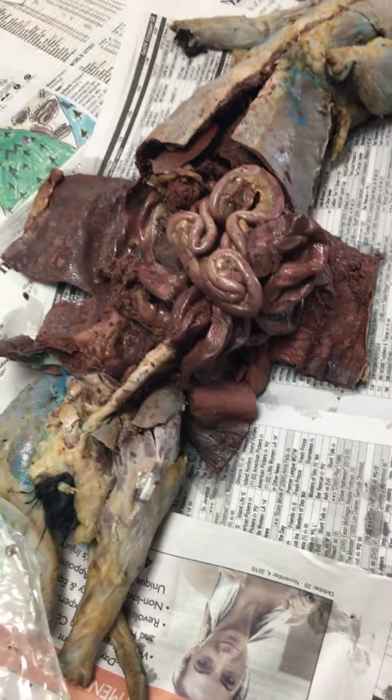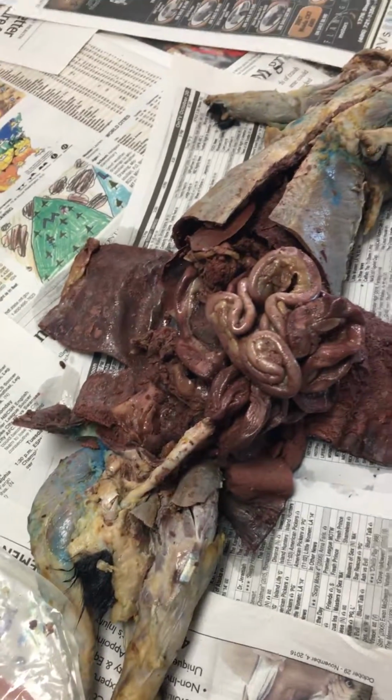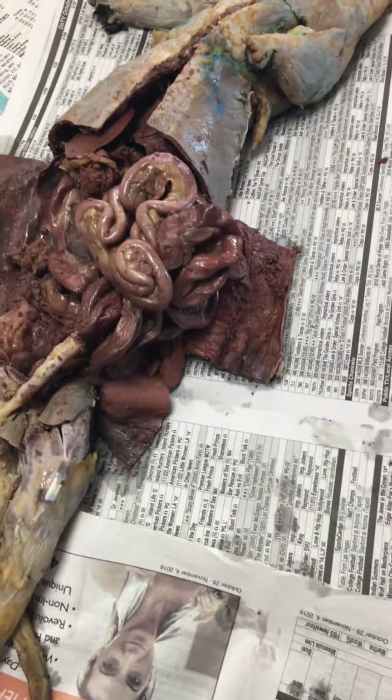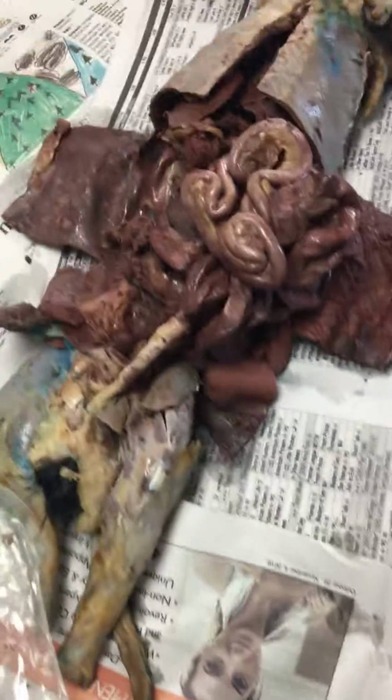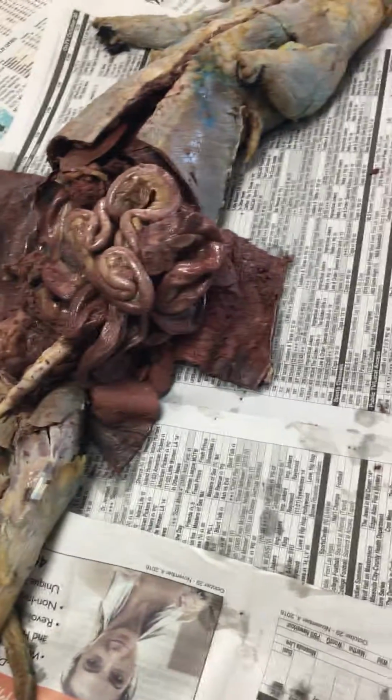So what's the little lobe that's attached to the little covering that goes over it? What's the covering called? Like the little fatty tissue? That stuff right there, greater omentum. Okay, what's the kidney? Now that has an organ inside of it. Where's that? Since they cut yours off, we're going to have to go over there to look at that.